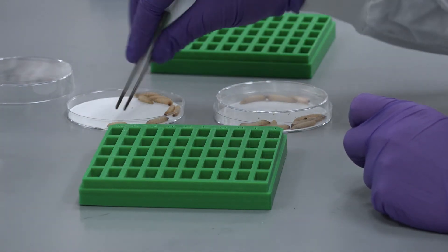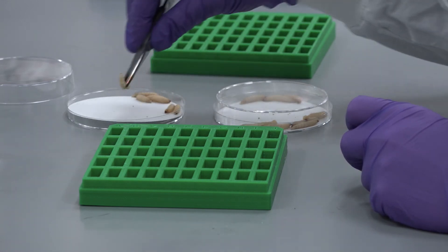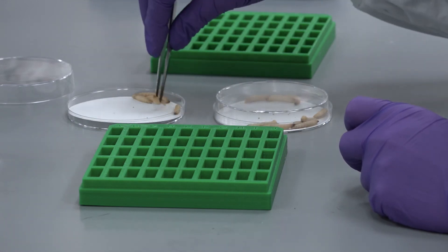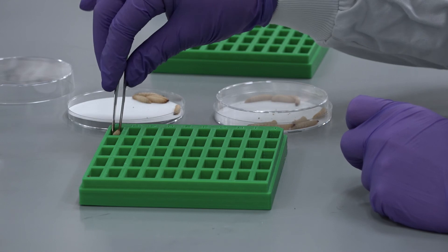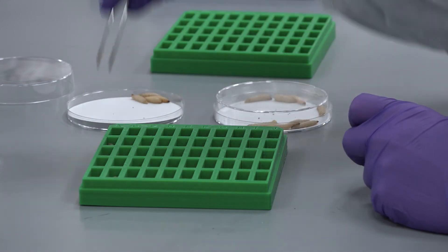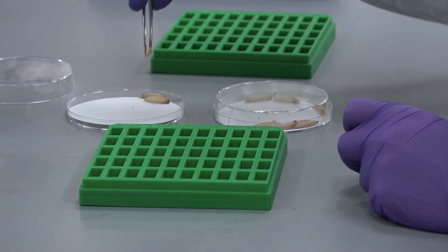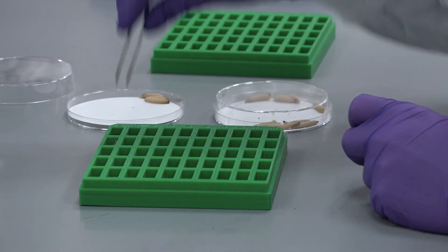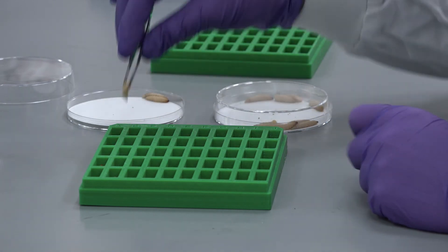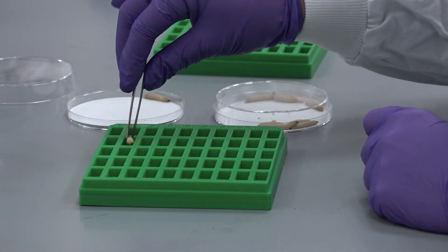The time course you decide upon is based around the infection dynamics of your pathogen. For example, Acinetobacter baumannii has to be monitored hourly for at least five hours post infection, whereas Pseudomonas aeruginosa must be monitored after 18 hours.